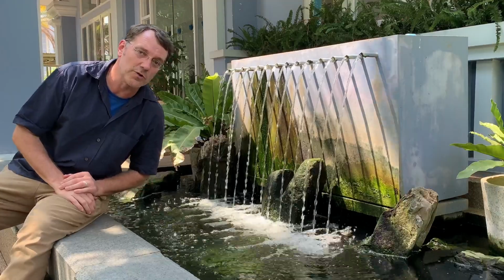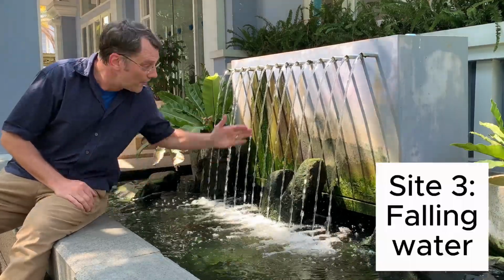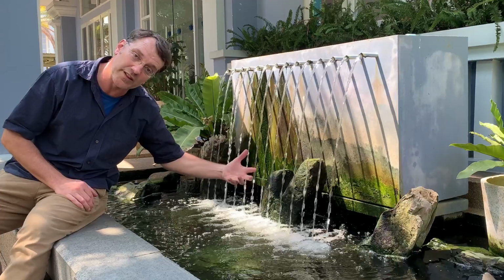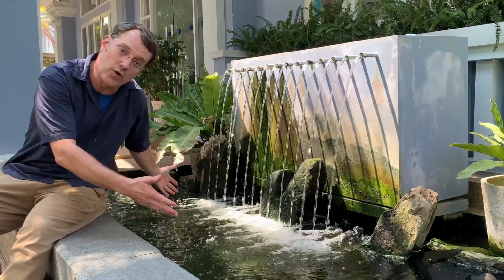The next site we're going to investigate is this fountain right here in front of school. As you can see where the water falls into the pool, we've got all these bubbles happening. We want to see if that falling turbulent action affects the dissolved oxygen content in this water source.